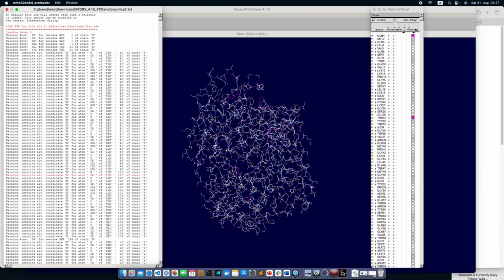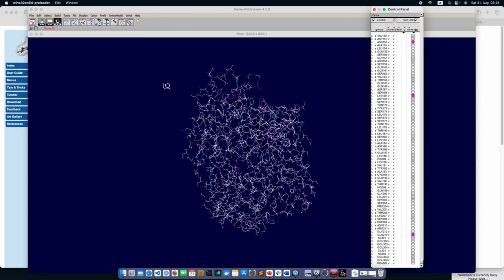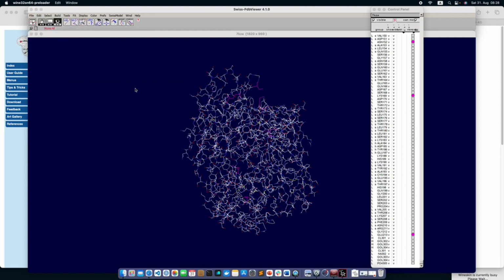So okay, and then you see this window, and this is the window for all the residues, and here you can see some of the atoms are missing. So the missing atom is OG for residue serine 138 of chain H, and the residues which have been repaired by Swiss PDB Viewer will appear in pink. These pink residues are nothing but the ones where the missing atoms have been repaired already.